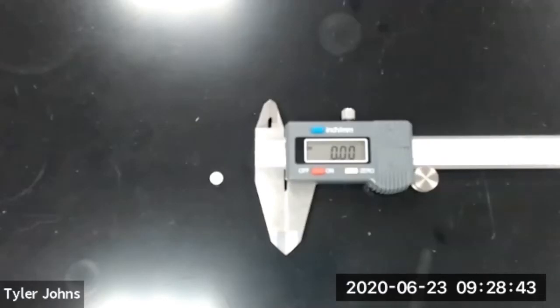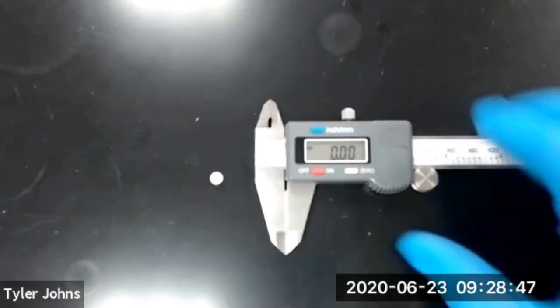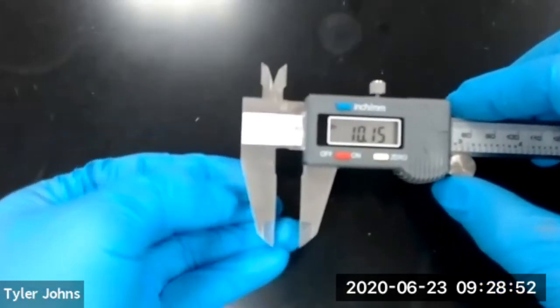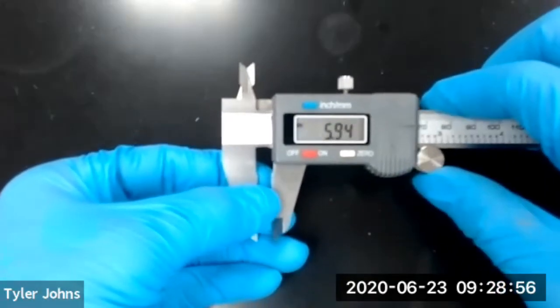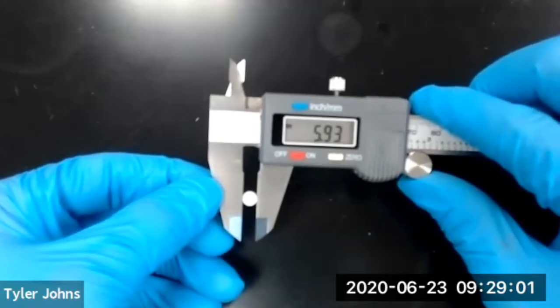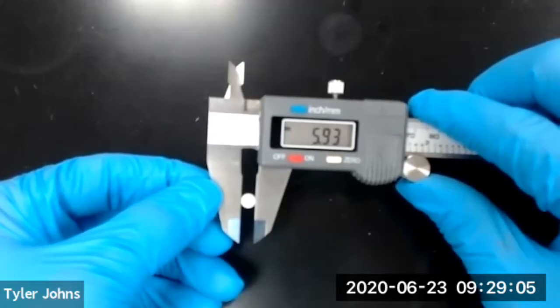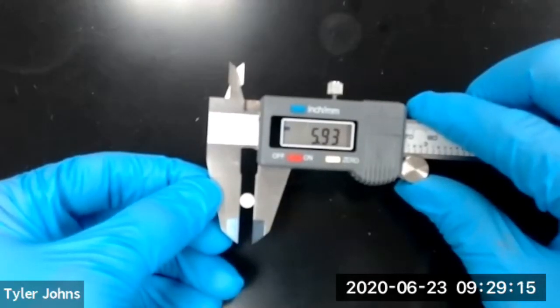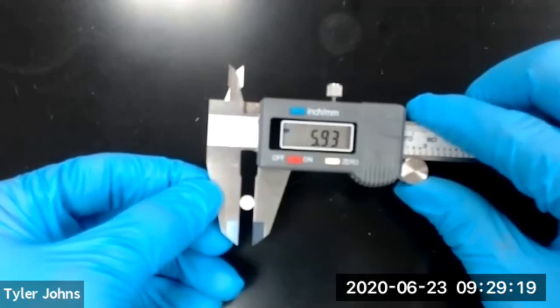The third object that we will be using today is a BB. We're going to use our digital calipers to determine the diameter of the BB. The diameter of our BB is 5.93 millimeters. You now need to use the formula to determine the volume of a sphere to determine the volume of the BB.